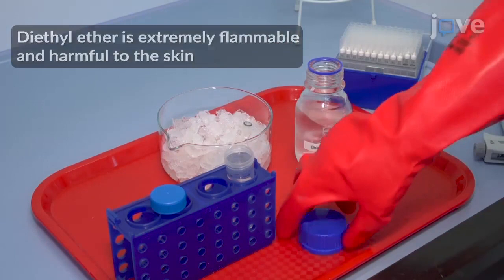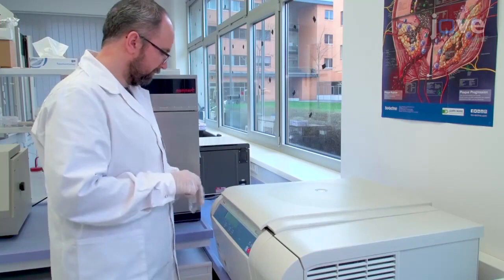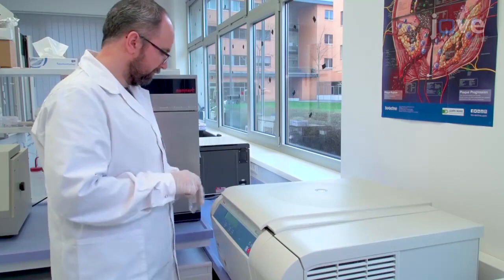Incubate for 2 hours at negative 20 degrees Celsius. Centrifuge at 2500 times G for 10 minutes at negative 10 degrees Celsius. Discard the supernatant.